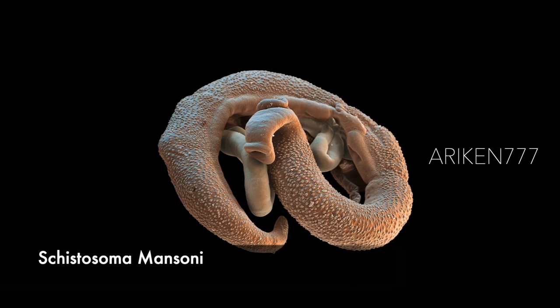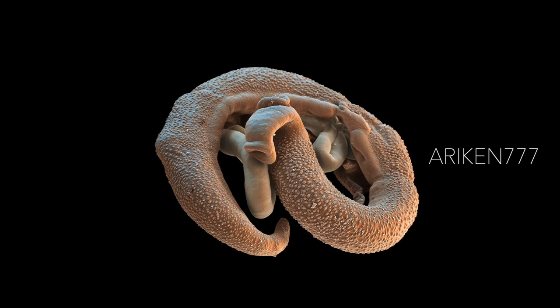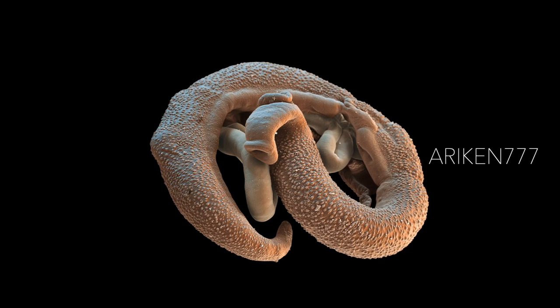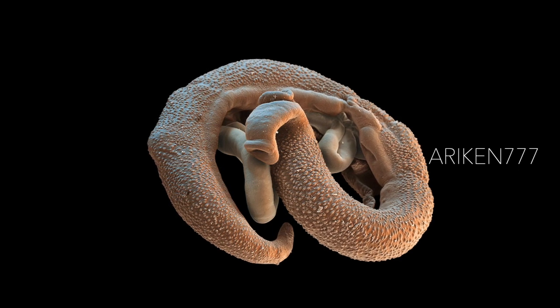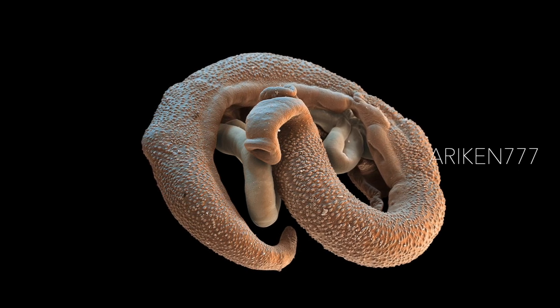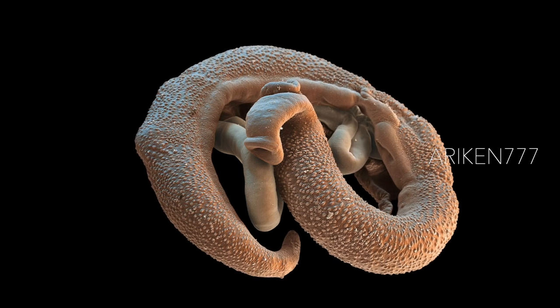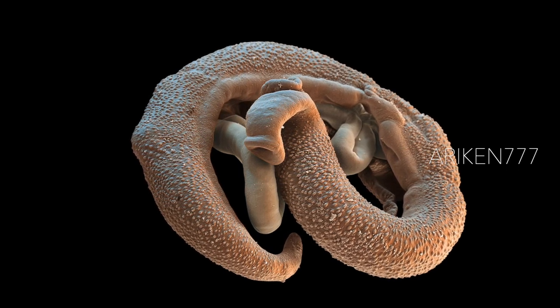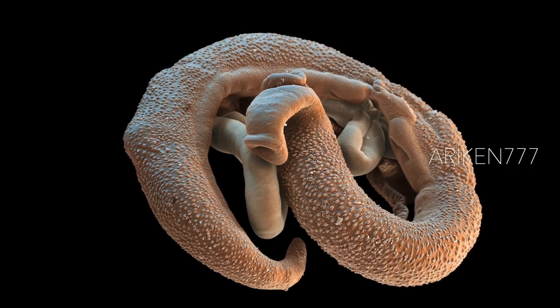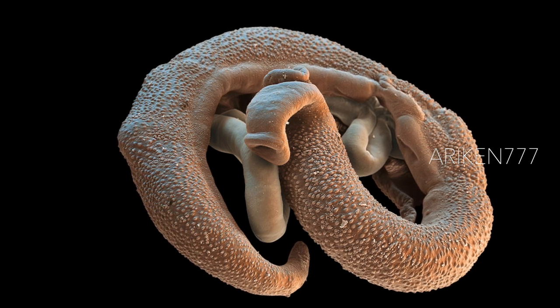This water-borne parasite of humans belongs to the group of blood flukes. This fluke lives in the veins of the intestines and bladder, attaching itself to blood vessel walls using a suction pad. The female lives in a groove on the male's back. It ingests blood cells through its mouth and its eggs pass into water in urine and feces. The larva produced can infect humans through their skin. It causes intestinal schistosomiasis and is the most prevalent parasite in humans.